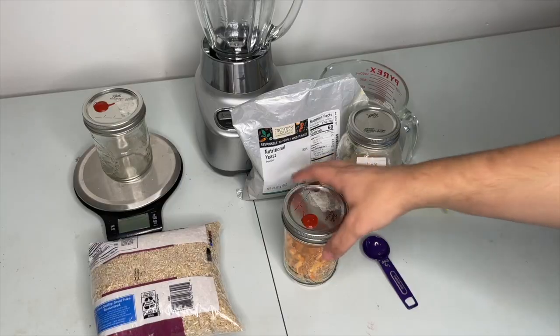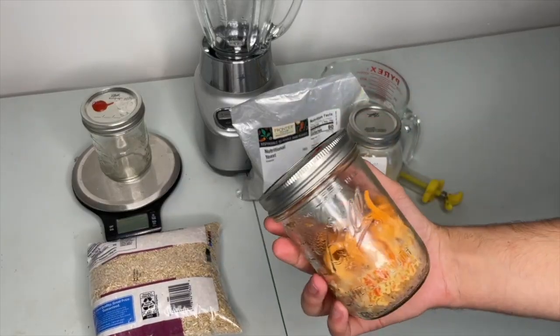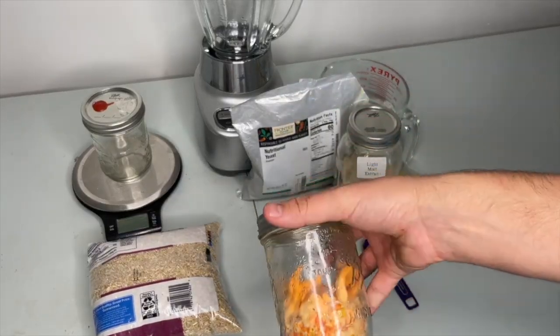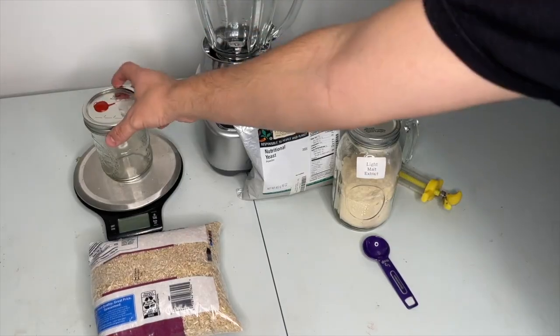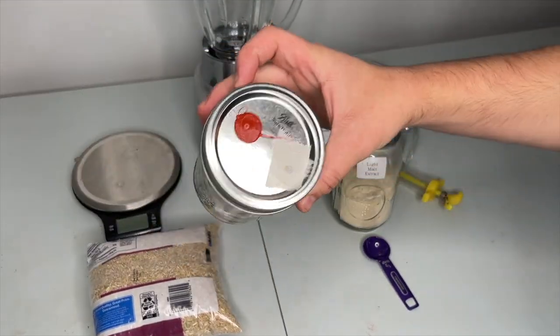If you don't have a laminar flow hood, this second method is going to be better suited for you. We will be using the same substrate in broth but just in different measurements.